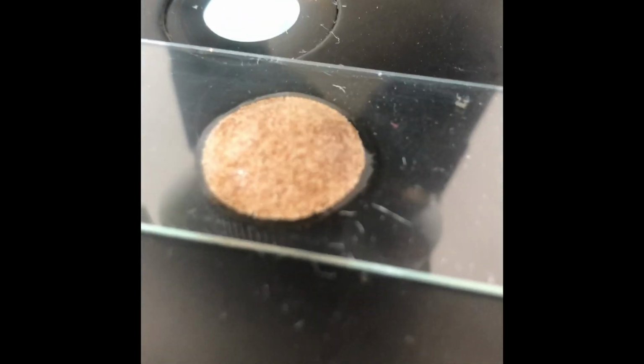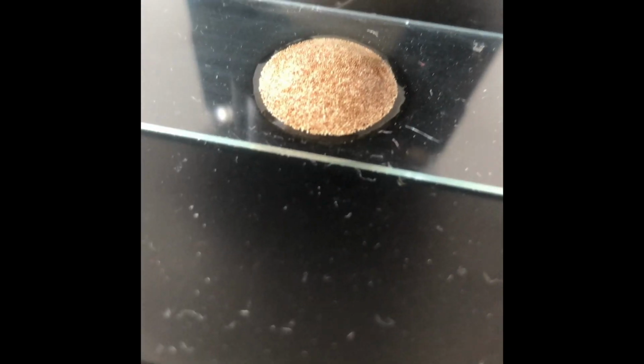Pretty cool, huh? This is what it looks like on the slide. This is what it looks like under the microscope. It's kind of cool that I am able to show you still. Look at that. Let's see if we can get even closer like that. There it is. All right, neat. All right, what's our next step? What do you think? Should we try to hatch these guys?